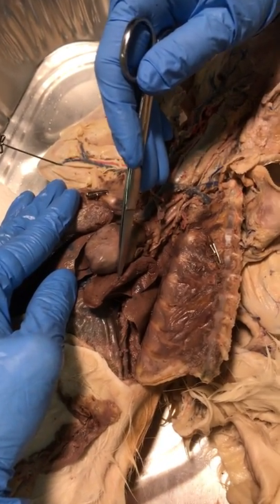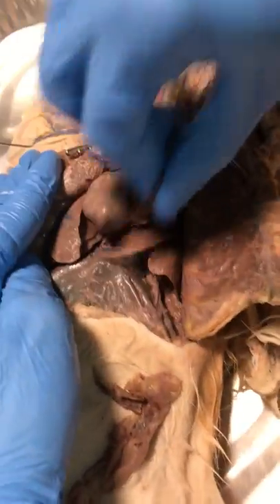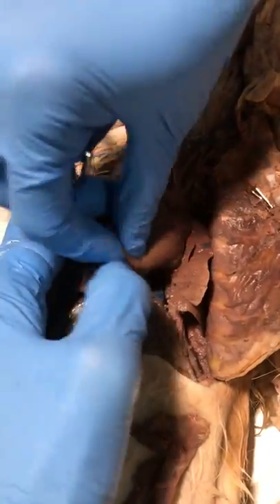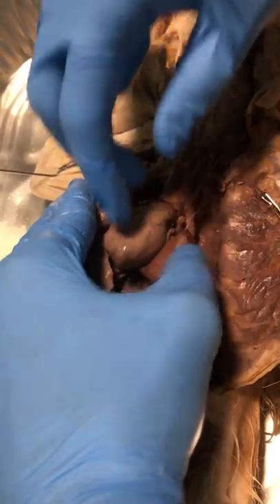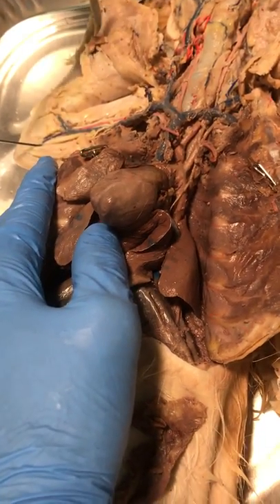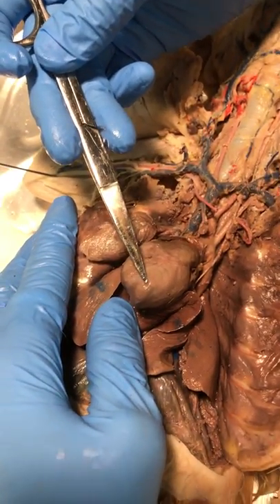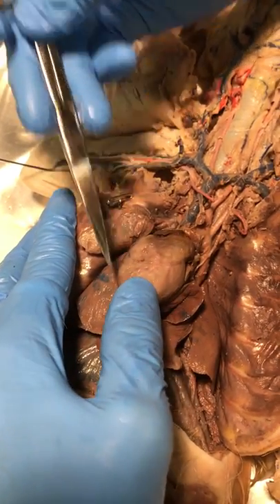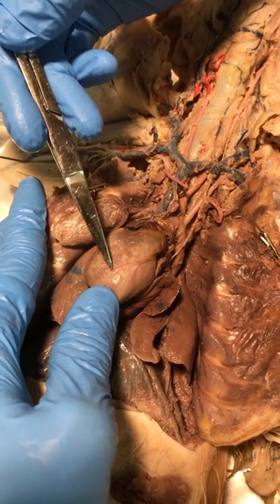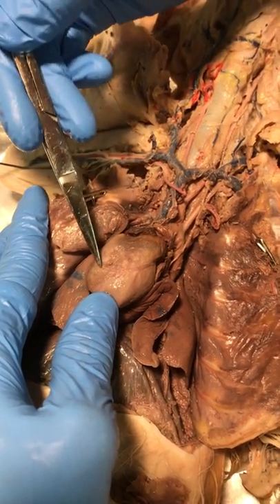Here are the lungs folded down. Here's where they are normally around the heart, but I've moved them so that you can see the artery review. Let's reorient. Here's the heart. Here's the apex of the heart. Here is the anterior interventricular artery separating the left ventricle from the right.